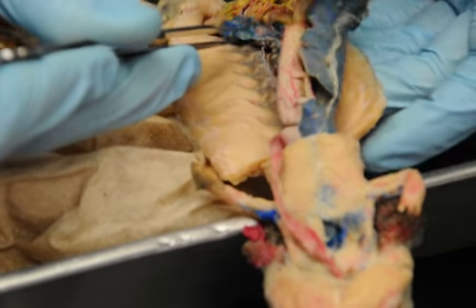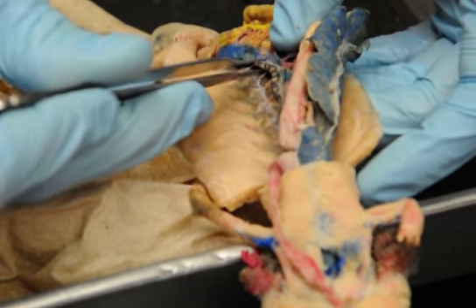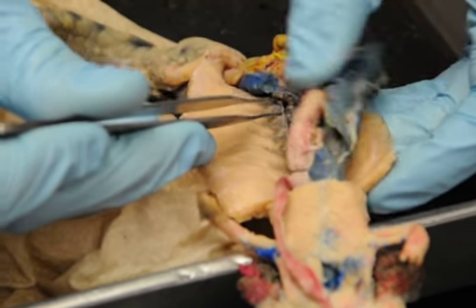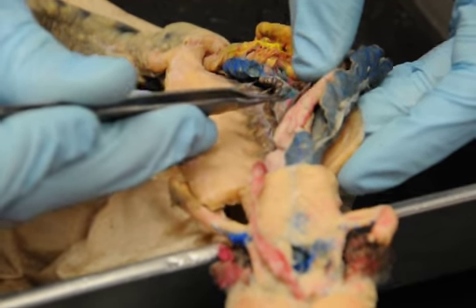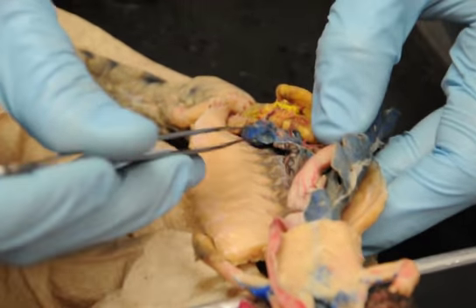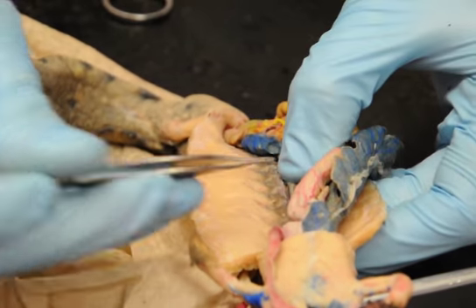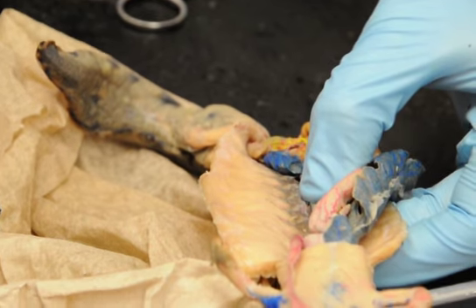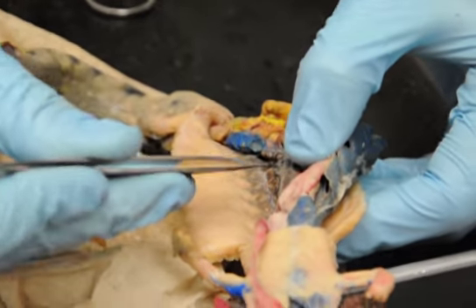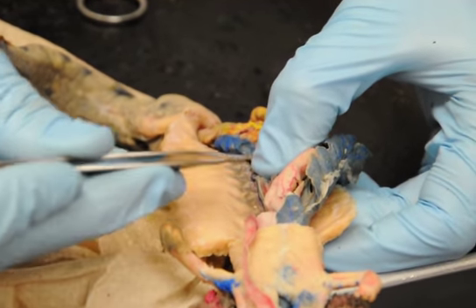They are like the shark, they run alongside the dorsal aorta, so it's kind of hard to really delineate between them, but I think there's some better mud puppies for trying to show you that. But basically you have the dorsal aorta, and actually I think Erica and Robin, you guys have a good mud puppy for posterior cardinal veins because you can see the dorsal aorta and you can see the posterior cardinal veins on either side of it.